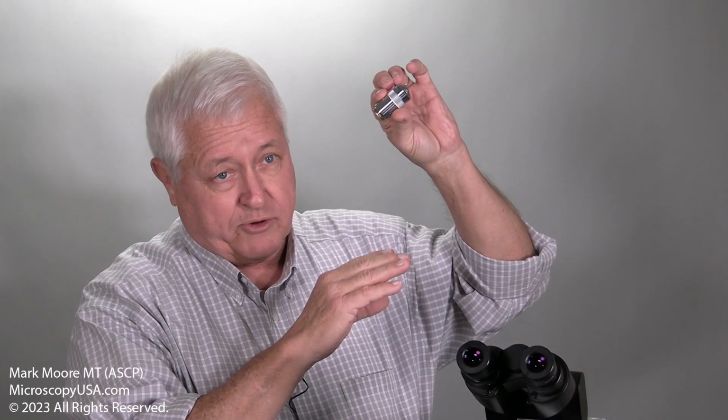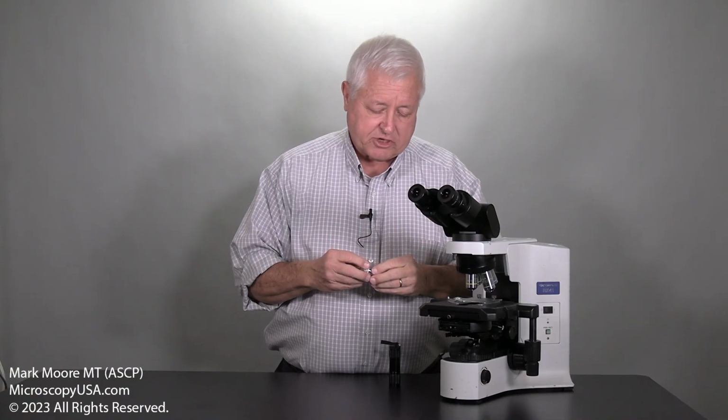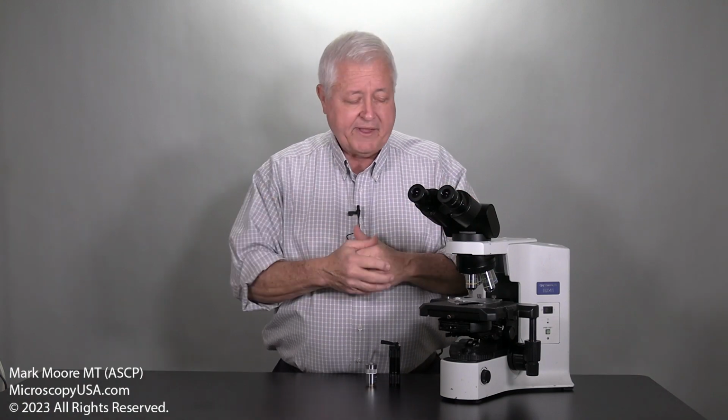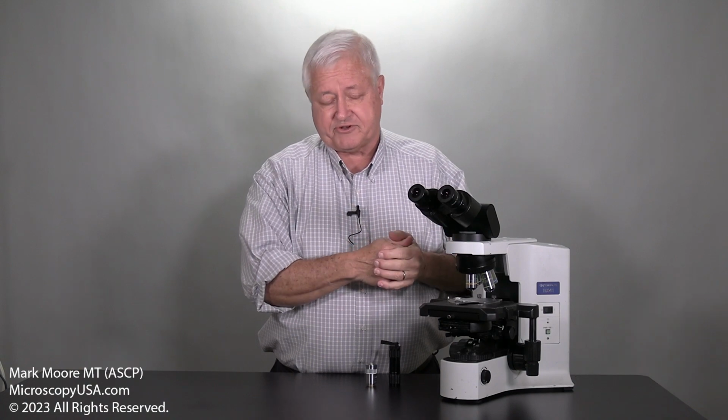Or you can hold it up to a light, and sometimes you can see a meniscus of oil through the back end. That's very bad. At that point, the objective is probably ruined and not serviceable, and you know that that's the cause of the bad images. The other thing, the ultimate test though, is that once you've cleaned the objective, put it back on the microscope and see if the problem is still there.